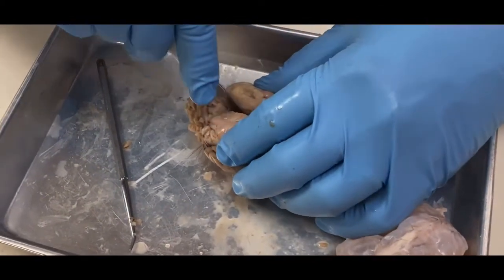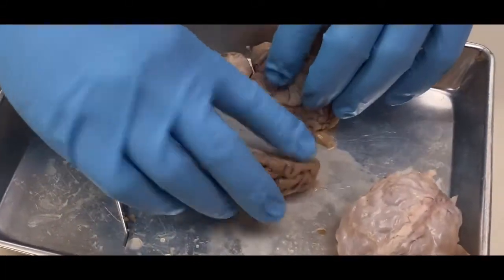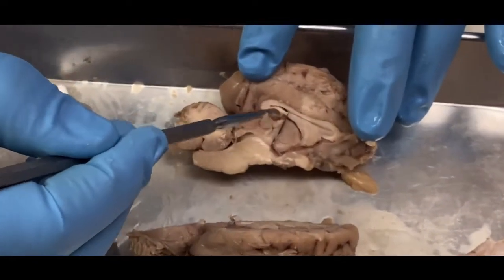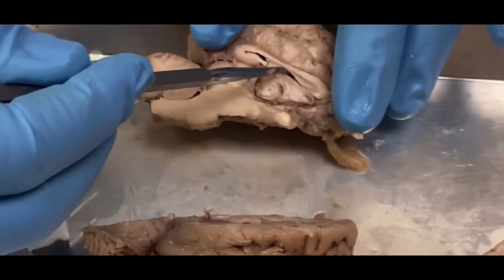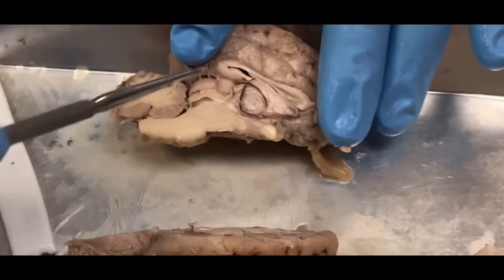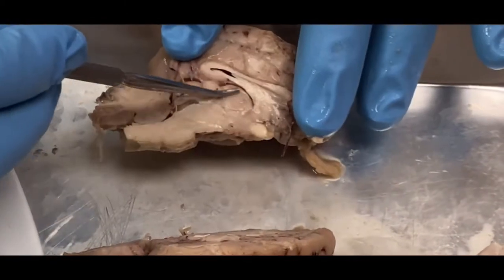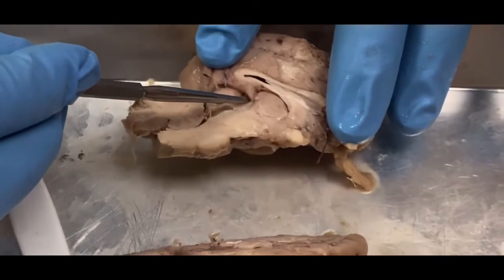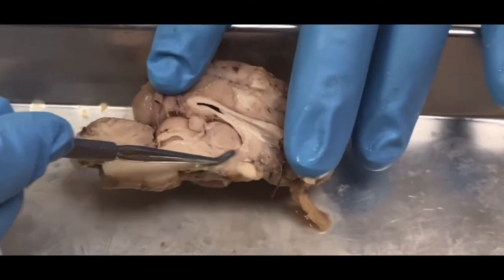Okay, and if I cut the brain in half, we're going to notice a few structures here. So once again, this is going to be my corpus callosum, which is right here. That helps the right side of the brain communicate with the left. This opening in the corpus callosum is my lateral ventricle, and my lateral ventricle contains ependymal cells, which make up the choroid plexus, which is going to make cerebrospinal fluid. This here is the thalamus. Okay, and then this up here again is my pineal gland, which is going to be the epithalamus. Then here I have my hypothalamus.